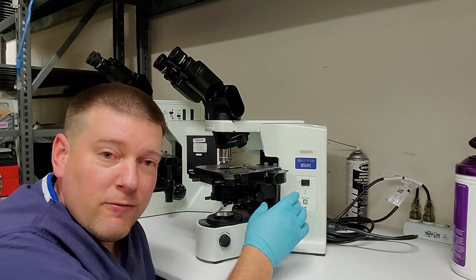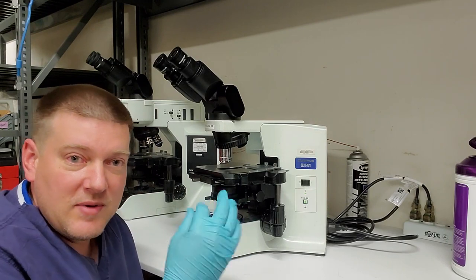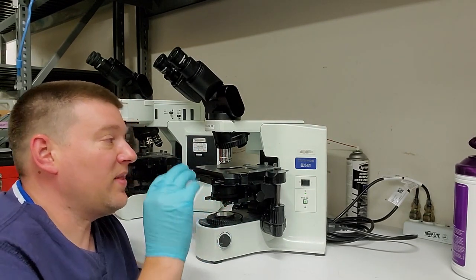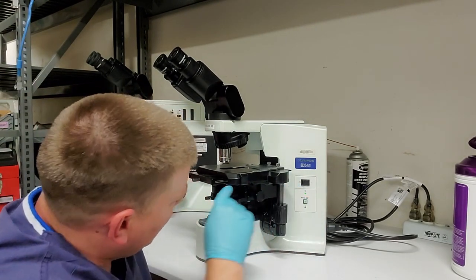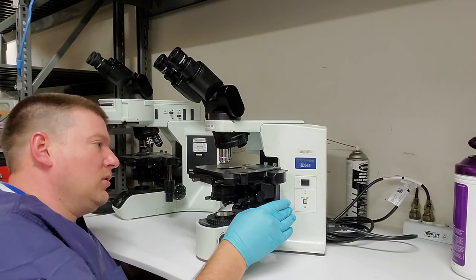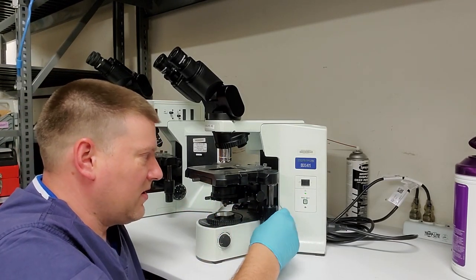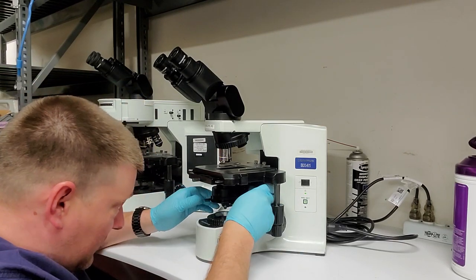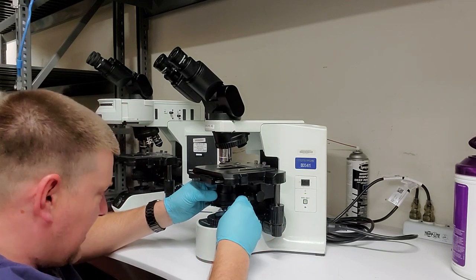You don't want to over lubricate them because, again, any oil that'll be remnants on the outside, people are going to be touching stuff and you don't want them to contaminate their microscope. These ways right here look like they're beautiful. They're well lubed. This doctor almost certainly takes care of their own microscope. So that is those two things. Now we're going to move down here, down to the condenser. All right.